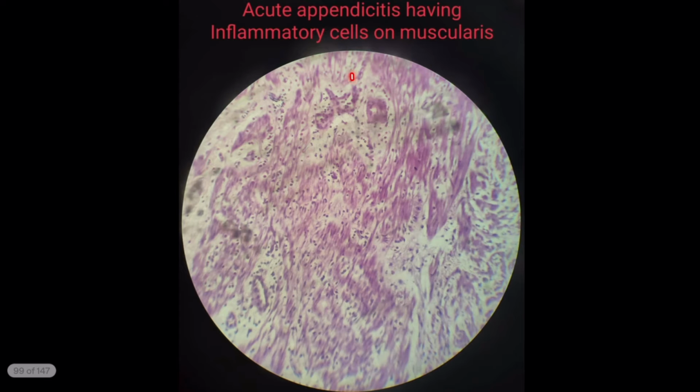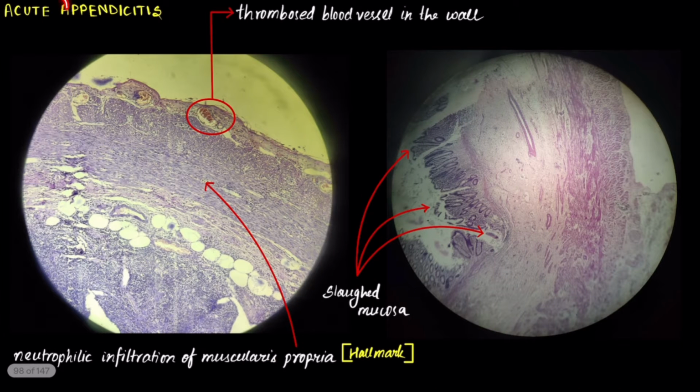Here's the hallmark feature. So there's your circular muscle, or the muscular layer, which contains the nucleus of neutrophils. Neutrophils, why? Because it is an acute condition. So that's the feature of acute appendicitis.